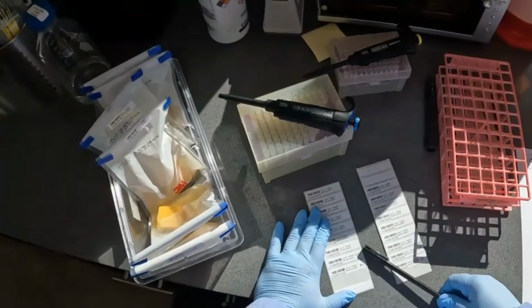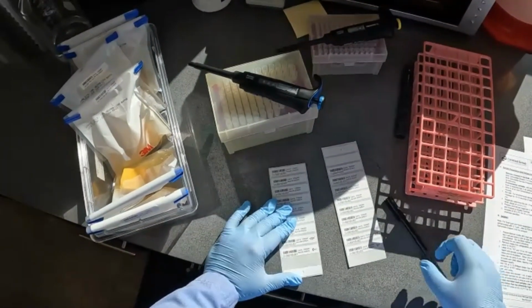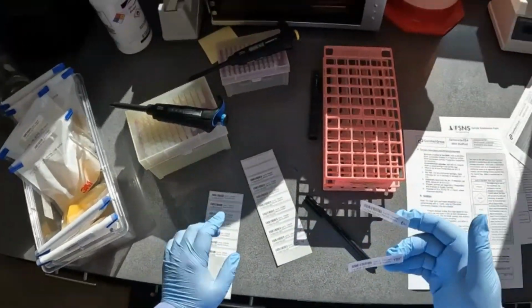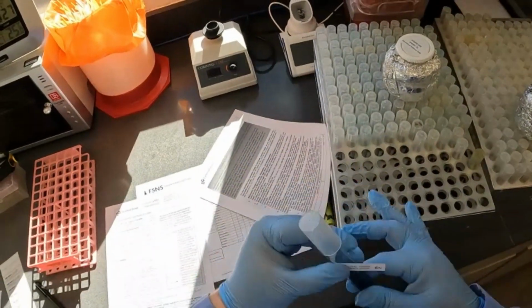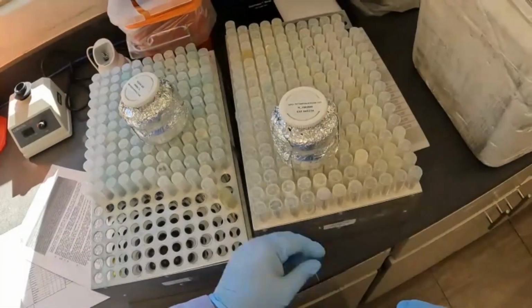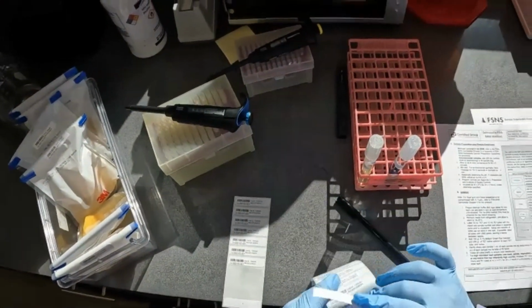So you can see here that I have some LIMS label stickers that I've printed, and I've labeled them RV and TET. So I'm going to label my first set of tubes for sample 1. So this is my RV. Grab my RV. I'm gonna place that in the sample rack, and then the same thing with my TET. Then I'm also gonna label sample number 2.